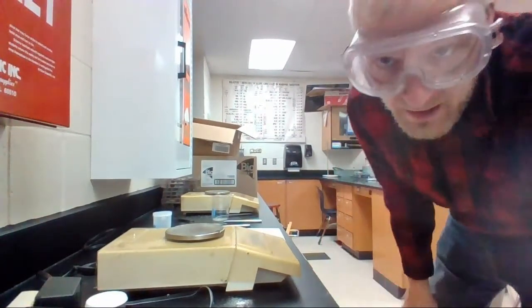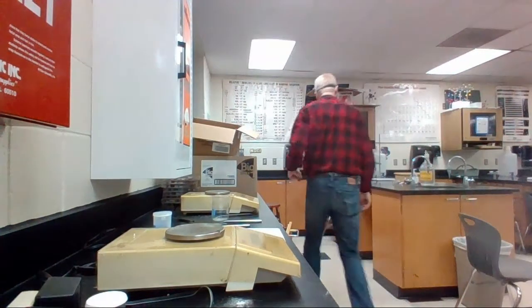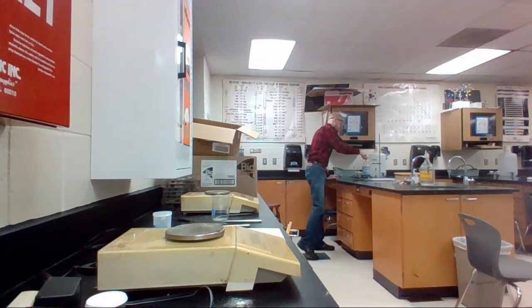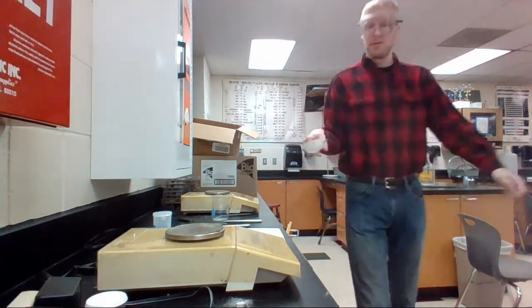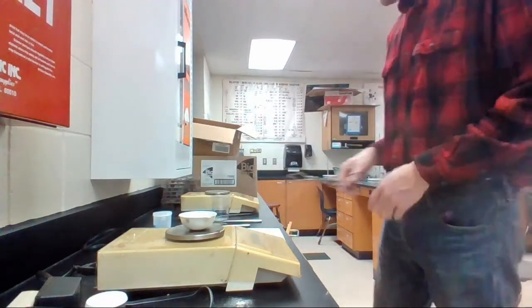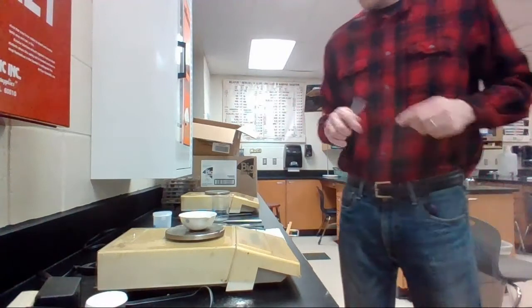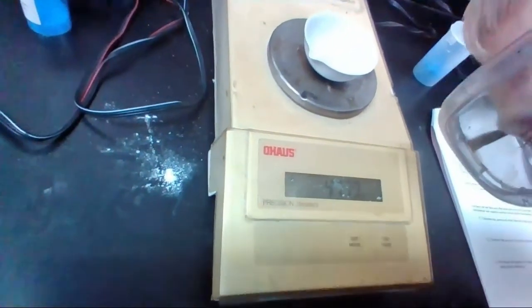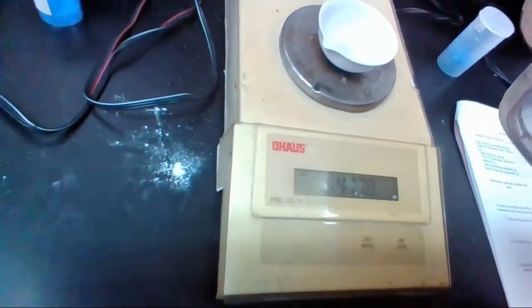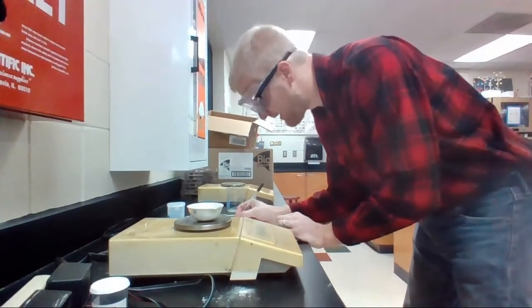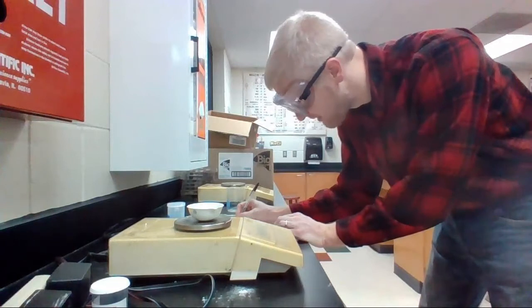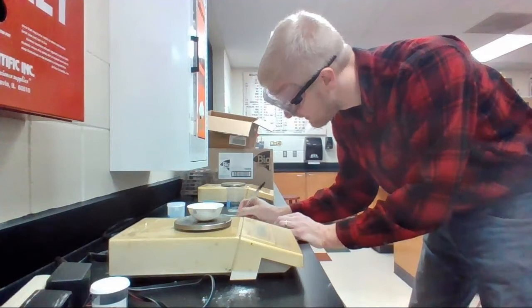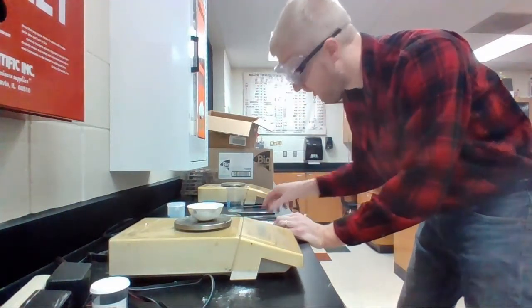All right. We are going to get the mass of this anhydrous. Let me go get it real quick. We're going to put it right on the scale. And we're going to record that new mass. And the mass is, well, I'll read it, 47.79. We're going to write that down. Mass of evaporating dish plus anhydrous substance is 47.79.